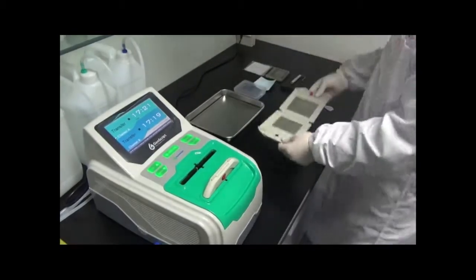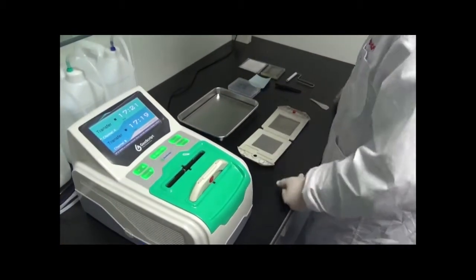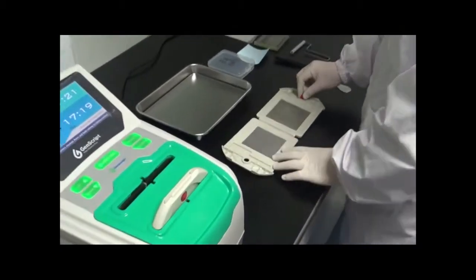Let's remove the transfer cassette from channel A. Open the cassette and lay it flat on the bench top.